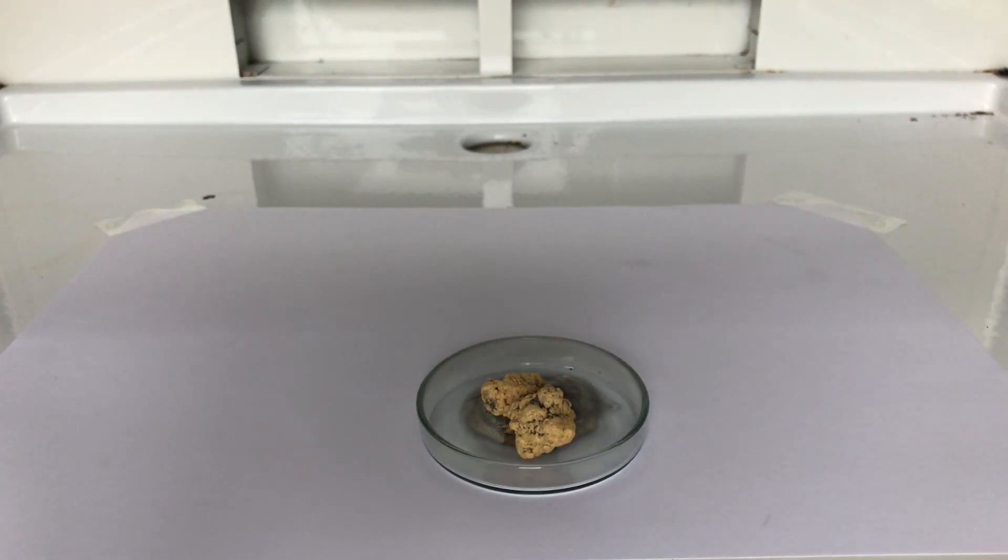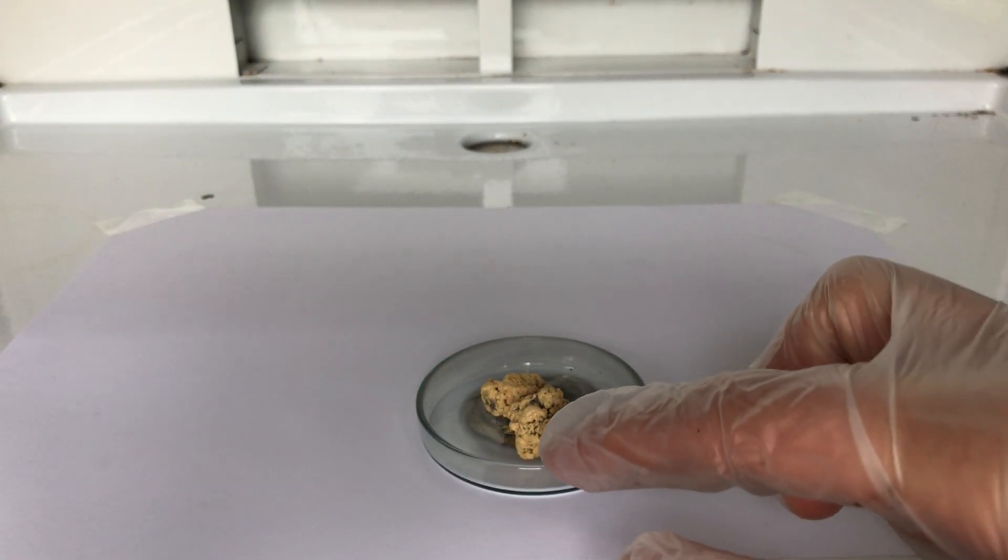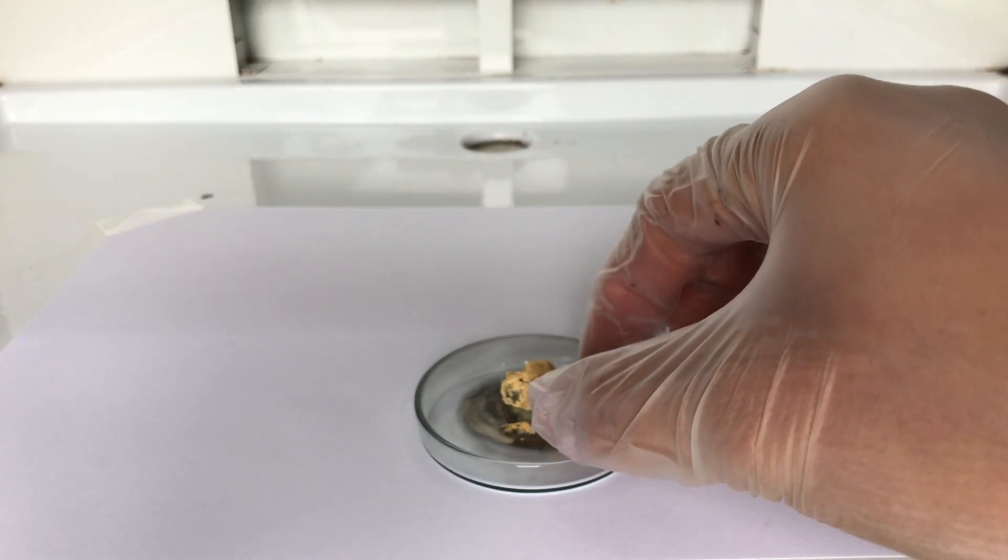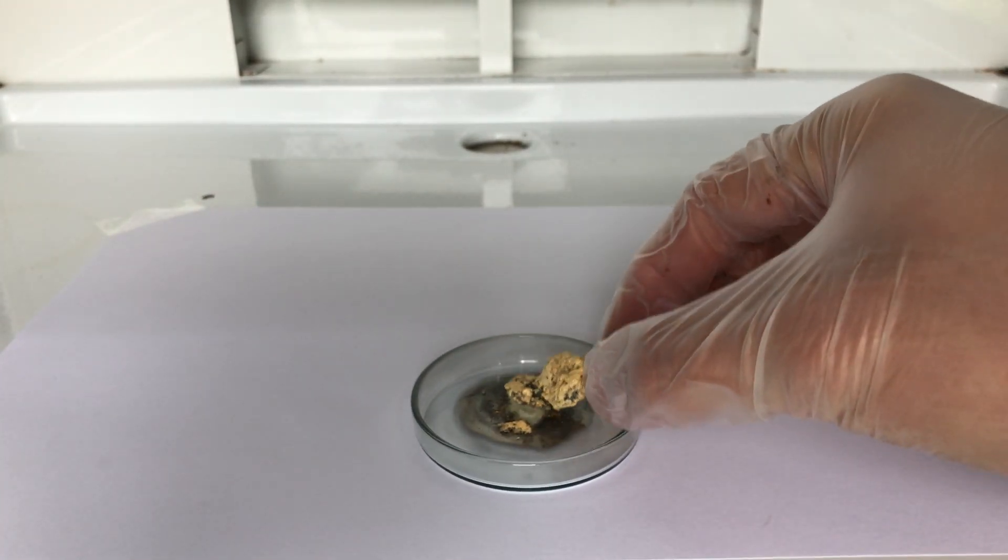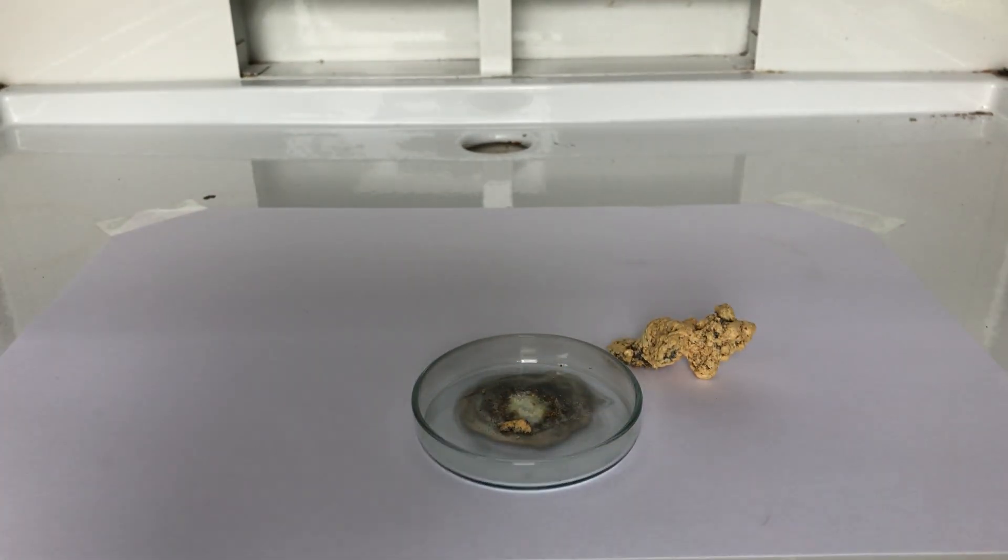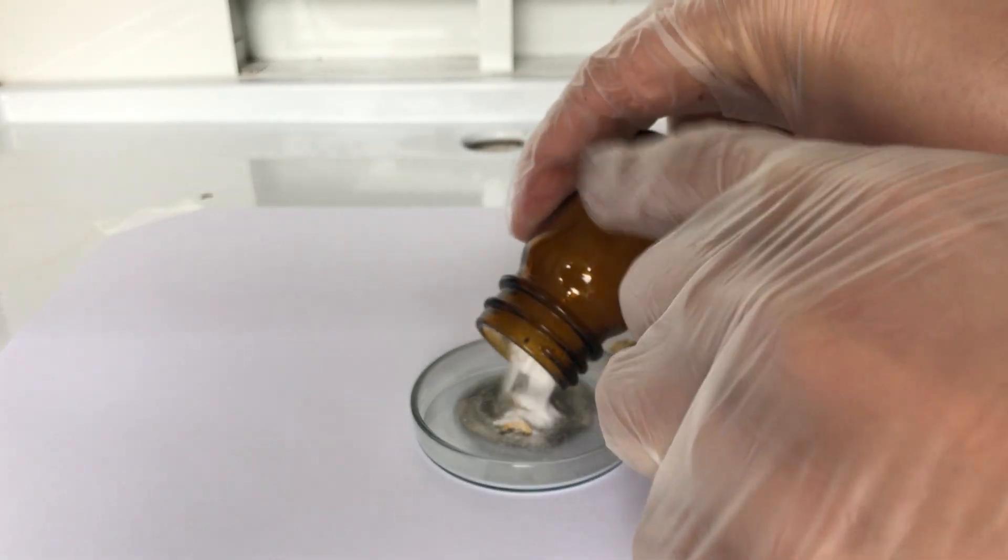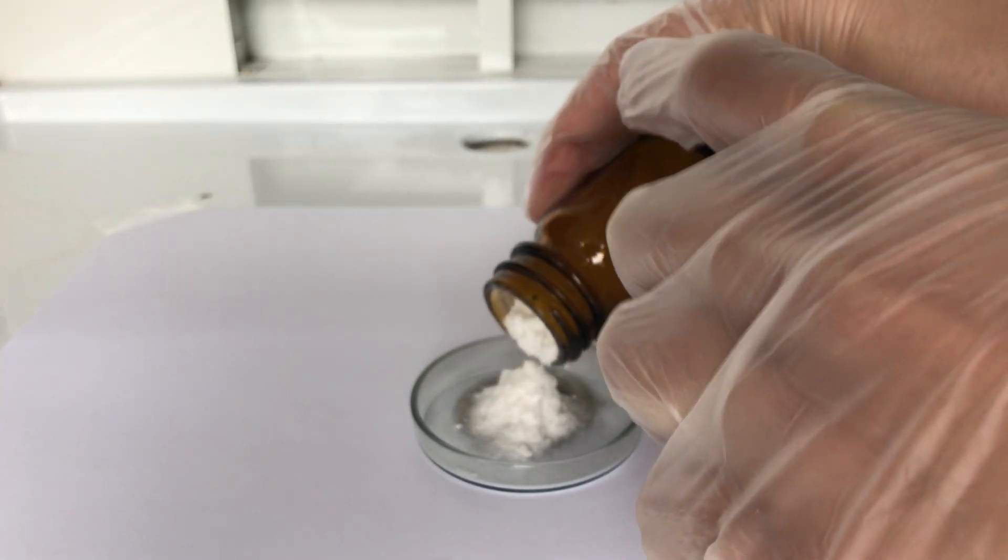I was a little disappointed with the first mercury snake, so we tried another one. This time we are going to use more mercury thiocyanate than the last time.